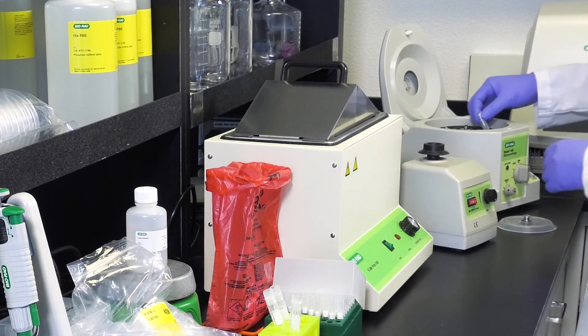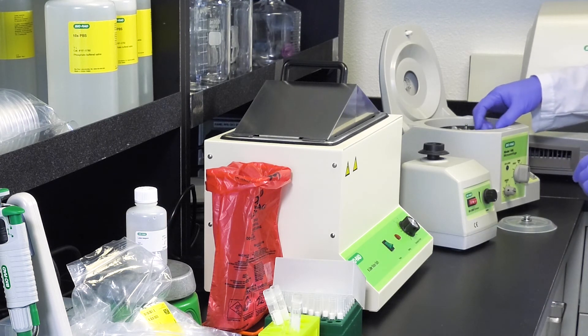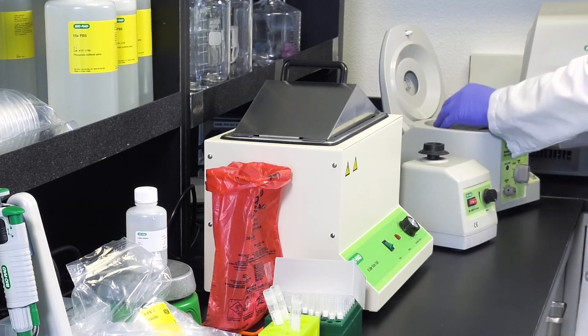Centrifuge for 3 minutes at 1,000 times G and then throw away the purification column. Note that the cap cannot be closed in this step.